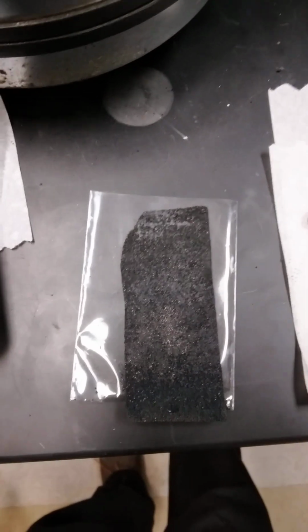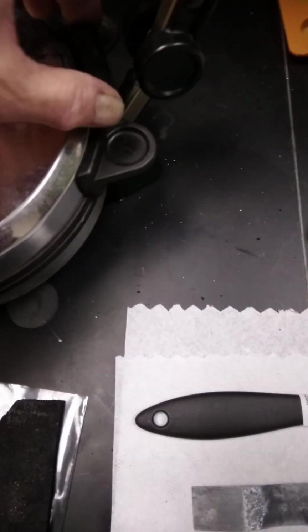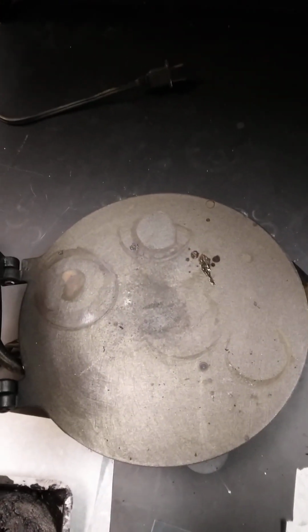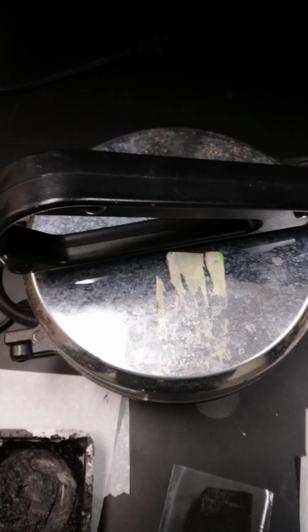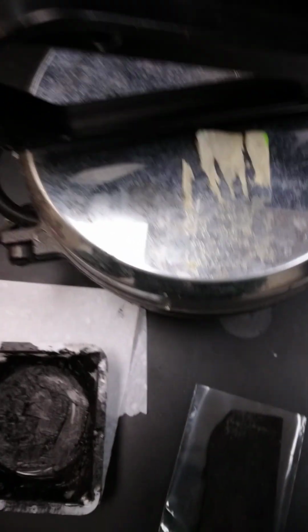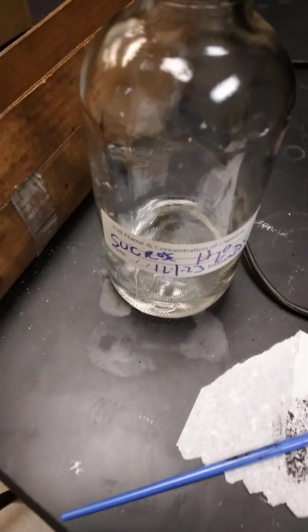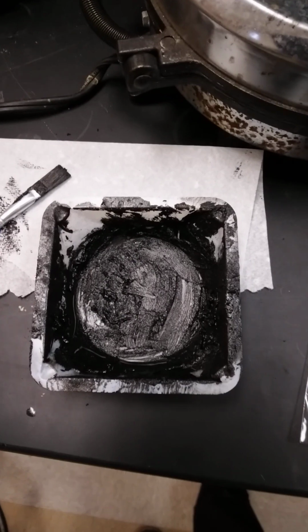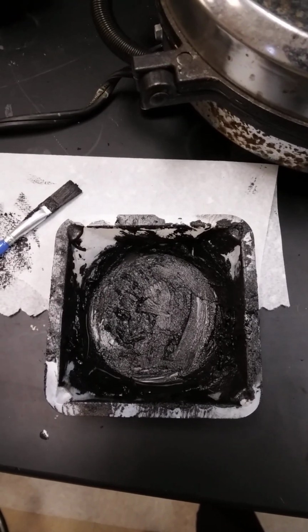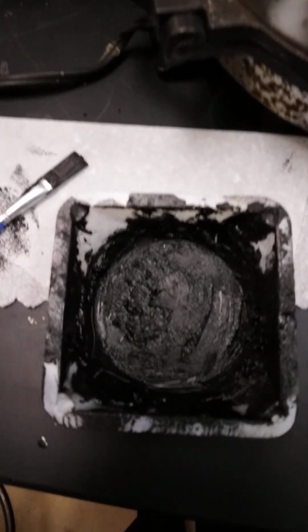It's experimental right now, but I was curious whether a pad such as this could be put on a taco plate, which I have around. They're very handy. And sure enough, what I do is I heat both sides of the electrodes just until I smell the caramel smell. And I've neglected to mention that I add aqueous sucrose, table sugar, to pack it together. And then heating it up, of course, you pyrolyze the sucrose, and that can give you your increased porosity. But I was very curious whether this would work before heating it up.